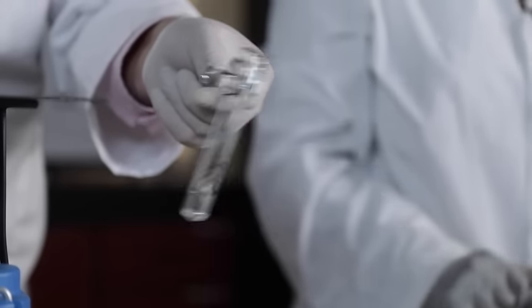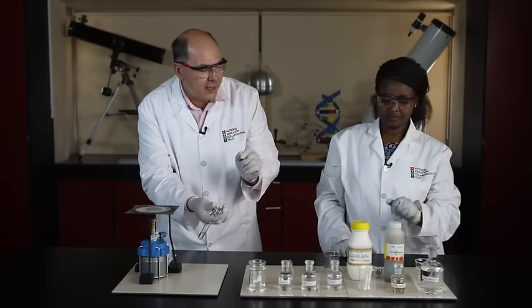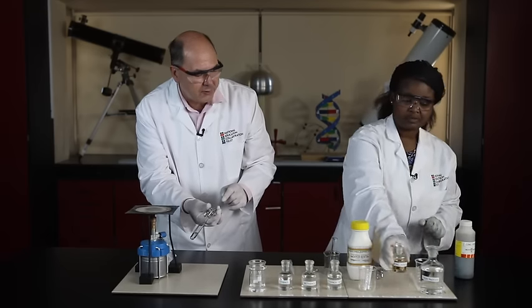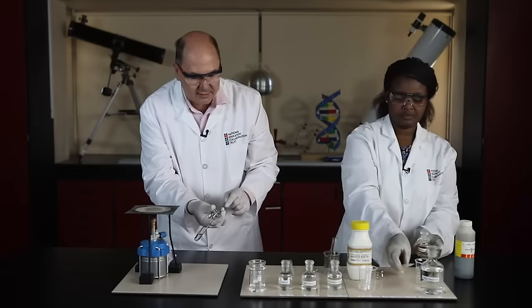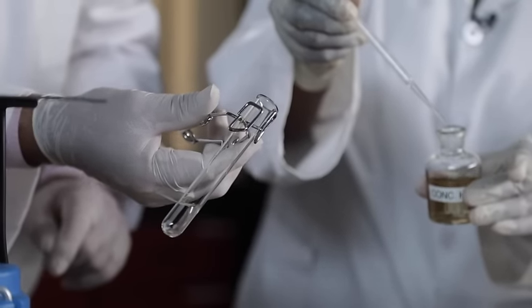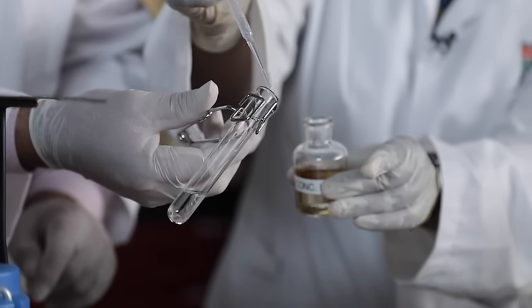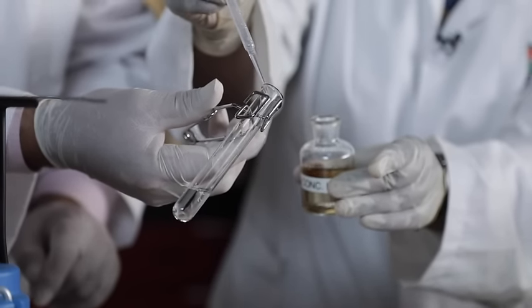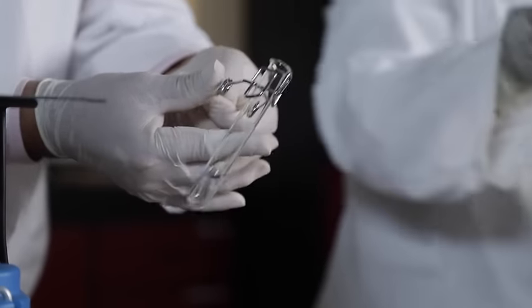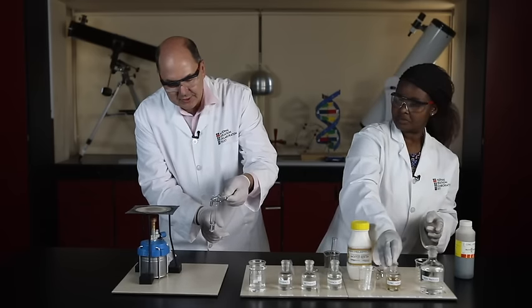There, we've got our carboxylic acid and alcohol. We need to add our catalyst. The catalyst is concentrated sulfuric acid, so we need to work very carefully now. So only 2 or 3 drops of concentrated sulfuric acid. We're going to run it down the side of the test tube and hopefully that will get the reaction going. There it's sliding down, it's one drop. Lovely, lovely. Swirl it. It doesn't look like much is happening, but this mixture is starting to get hot.